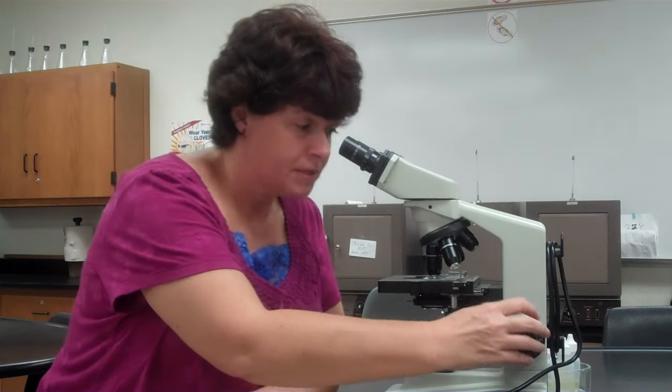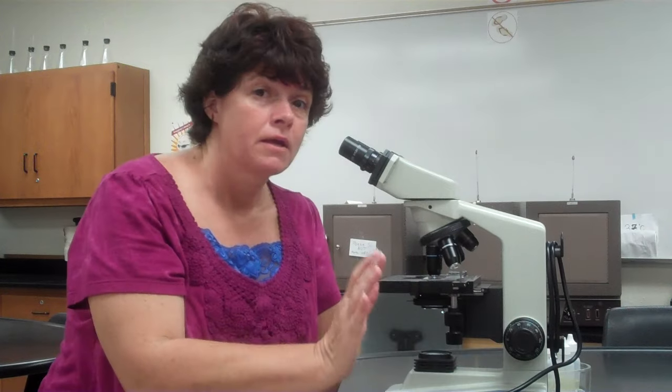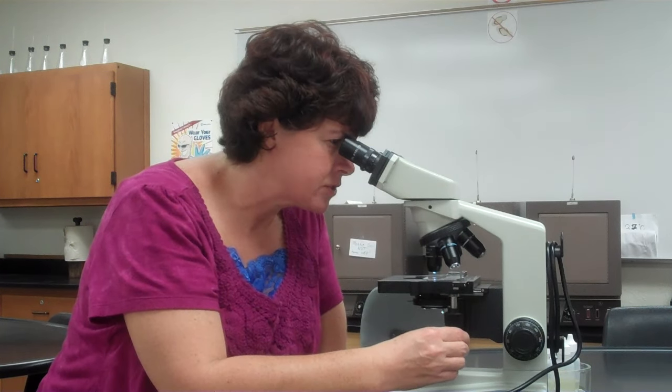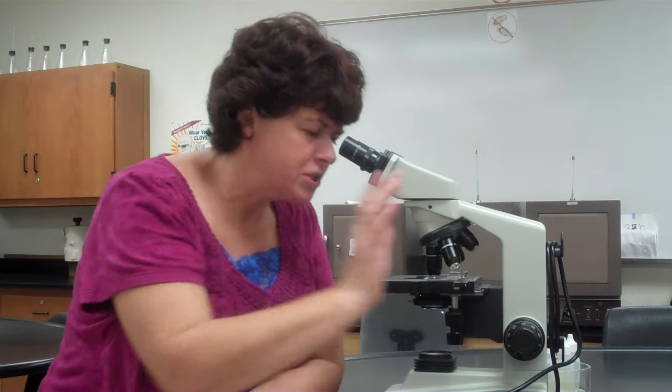Now I've refocused using the fine adjustment knob at 10x. Going to the 40x — notice I do not move the slide. These are parfocal microscopes, so it's not going to hit. On the 40x, only use the fine adjustment knob. As a rule of thumb, focus away from yourself and it will usually come into focus; if not, try the other direction. If you're just focusing and focusing with no result, go back to 10x and readjust — you may not be centered on the specimen.